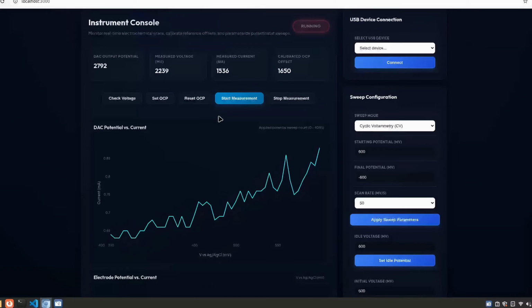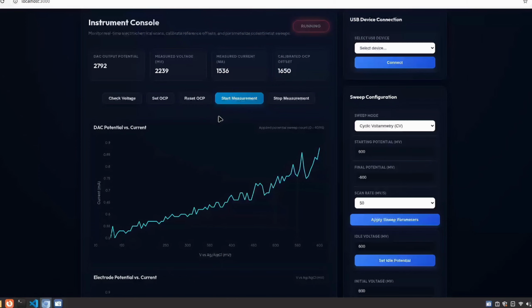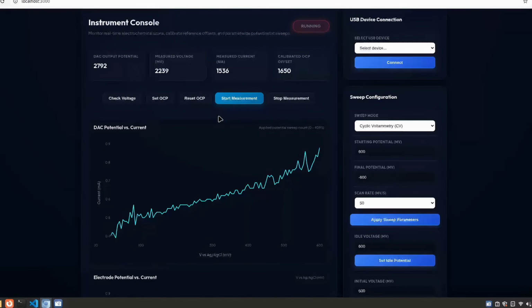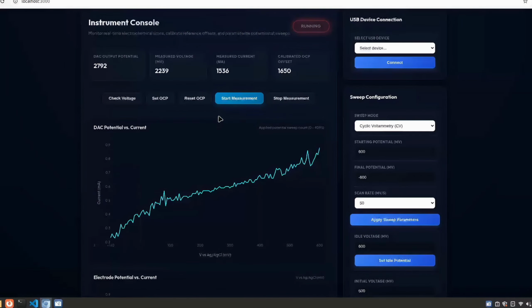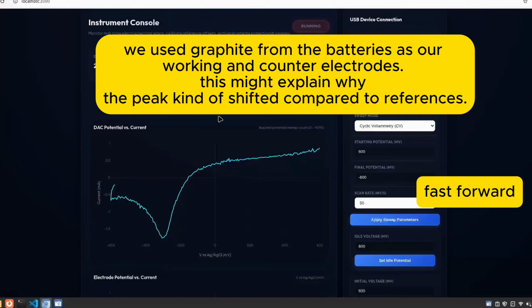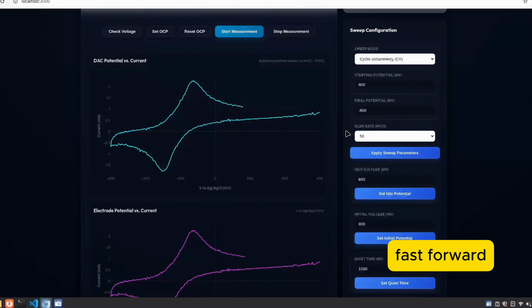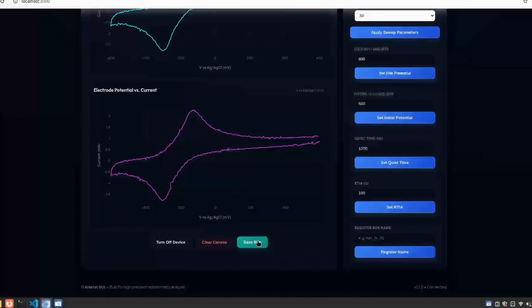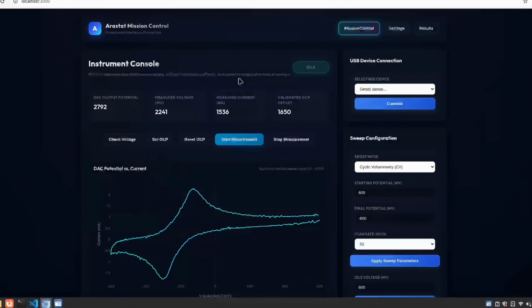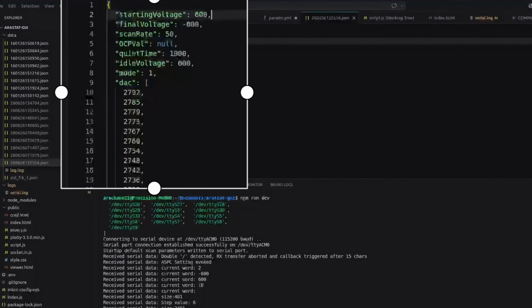During this measurement, we used the internal ADC instead of the external one due to some issues. Since we output raw data from the microcontroller, we calculate the data first before it's plotted. We have two plots: converted DAC value against current on top, and the reference voltage against current on the bottom. Click Save Measurement to save the data. We save the measurement data in the data folder, and we can see that the data and the parameters are recorded.